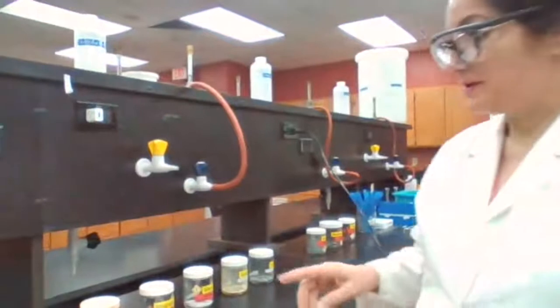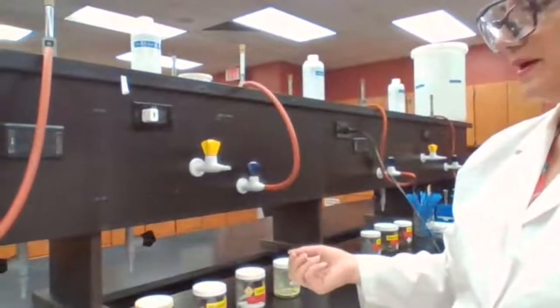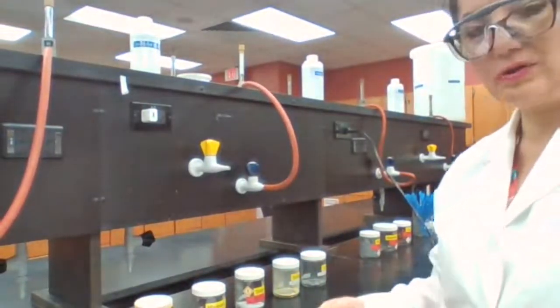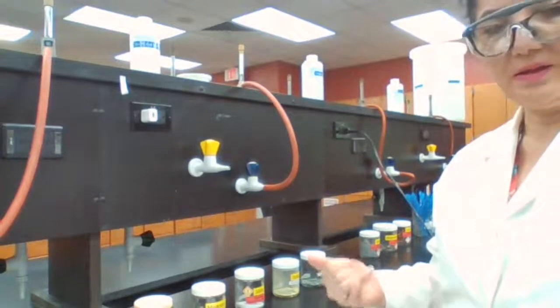In the first part, you have these chemicals, which are elements, and you want to know about their physical appearance, how they look, basically. At the end, you are going to come up with the differences between metals and non-metals.